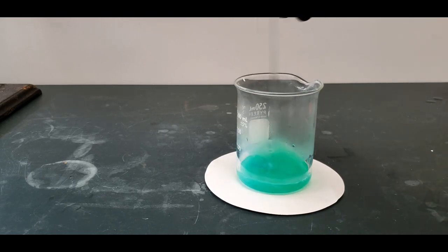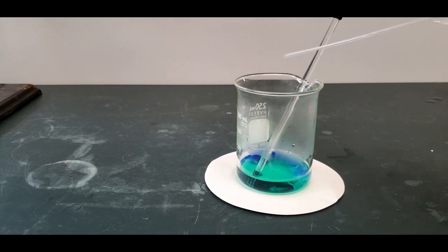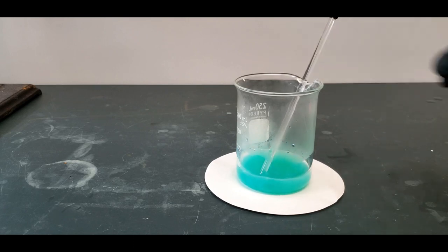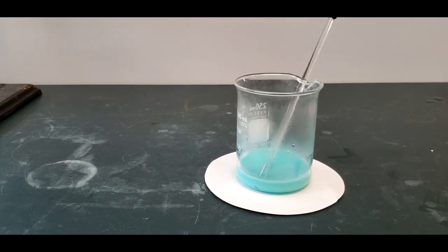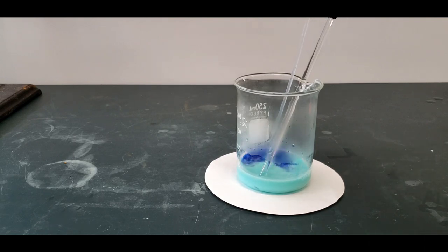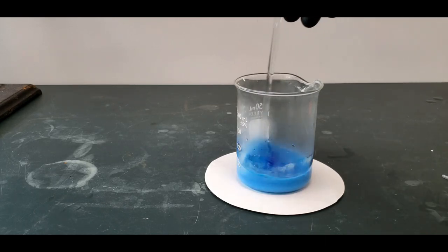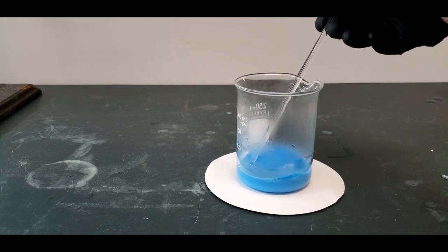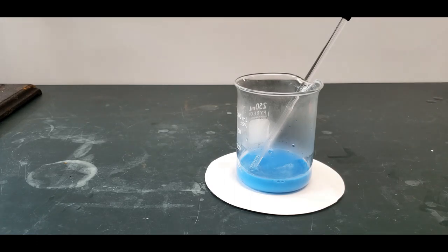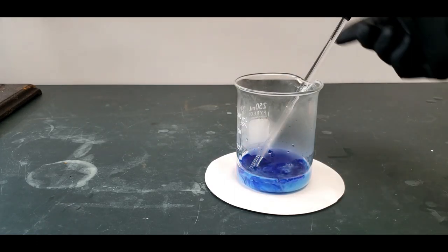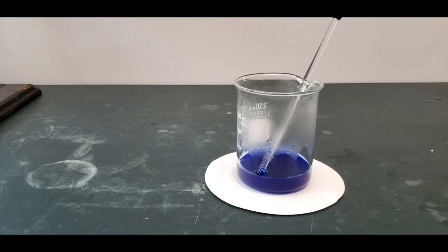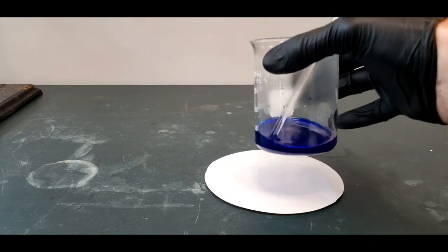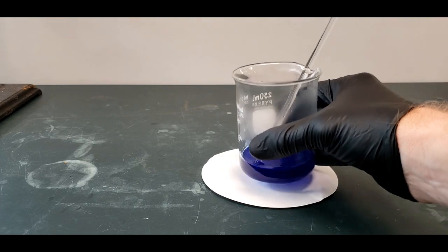I got to be more careful here. I don't want to go overboard with it either. That's probably quite a bit of copper two hydroxide in there. We just got to kick it over, have enough ammonia in here to form that complex ion. It's getting there. It's different color, but it's not that really pretty color. Each time I'm putting in about a mil. Oh, nice. There we go. So this is the soluble complex compound that they mentioned. You should write down your observations for that. And it is very warm.